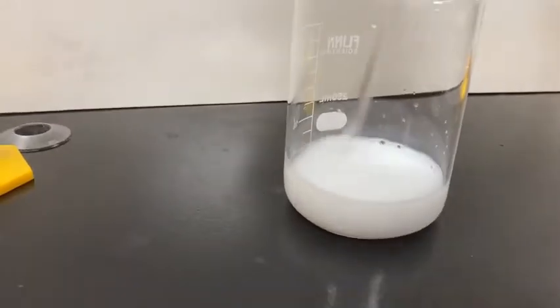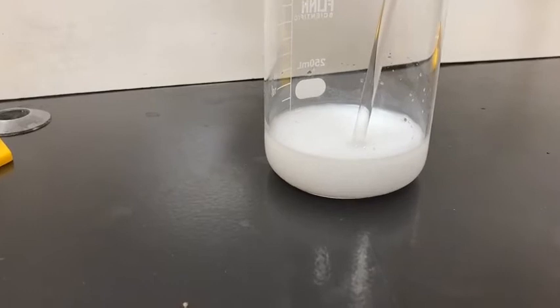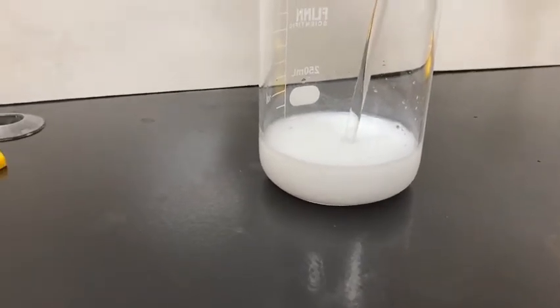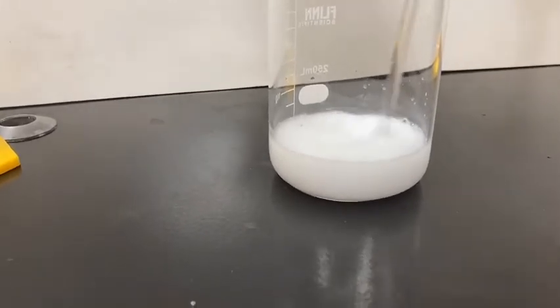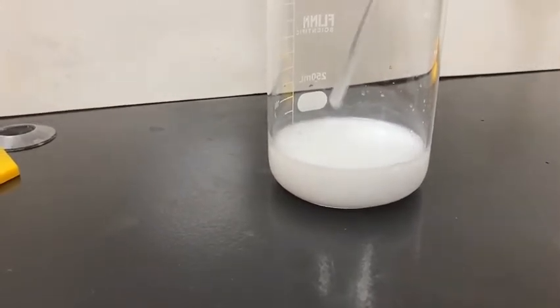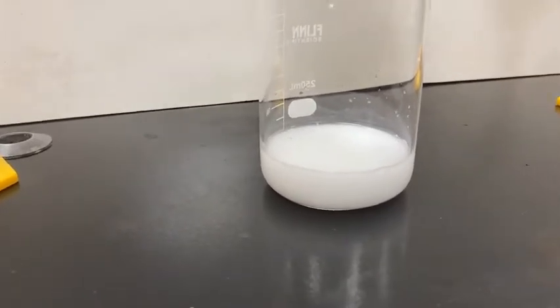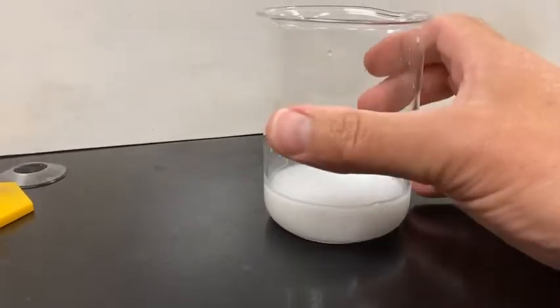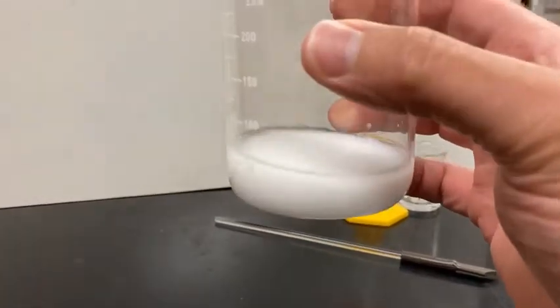So you notice it didn't all just solidify. We have the solid mixed in with a lot of liquid. Well, what's that liquid? That liquid is the product NaCl aqueous solution. It's a lot of the extra water that was already there in the solutions. And because we made the strontium chloride the excess solution, we've got some excess strontium chloride in there. So the NaCl, the strontium chloride, the water, those are all contaminants that I want to get out, and I just want to separate out that strontium carbonate precipitate that's there.